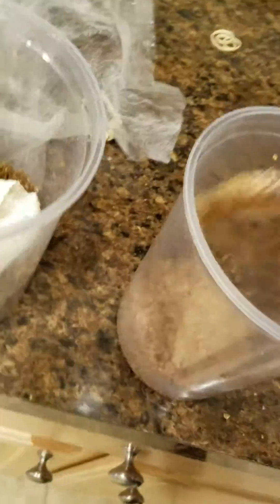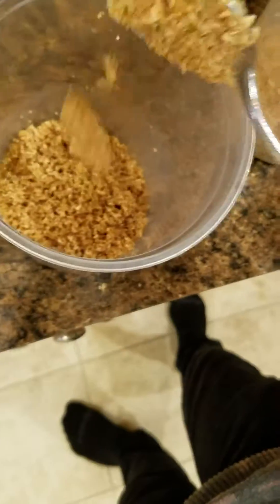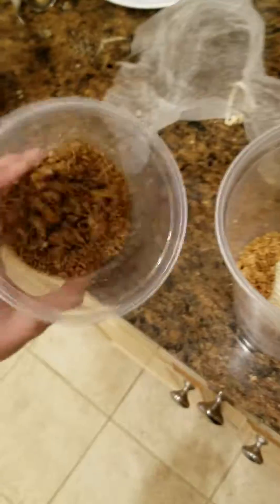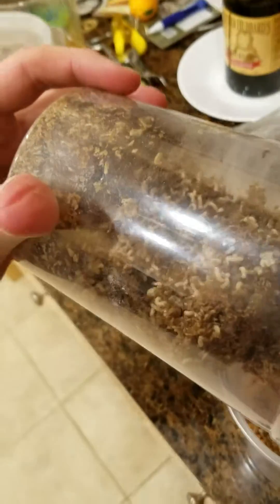Okay, here I go. Then I pick this up — that's just the paper towel the eggs were deposited on. And then what I want to do is just very carefully get half of the media and thus half of the maggots.